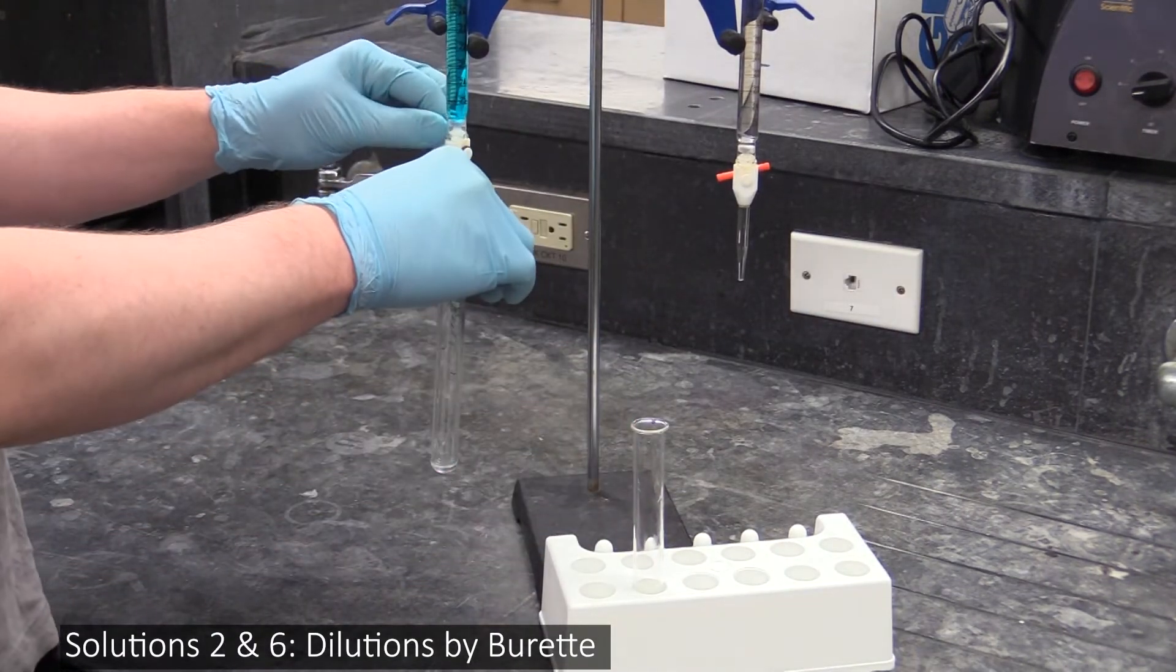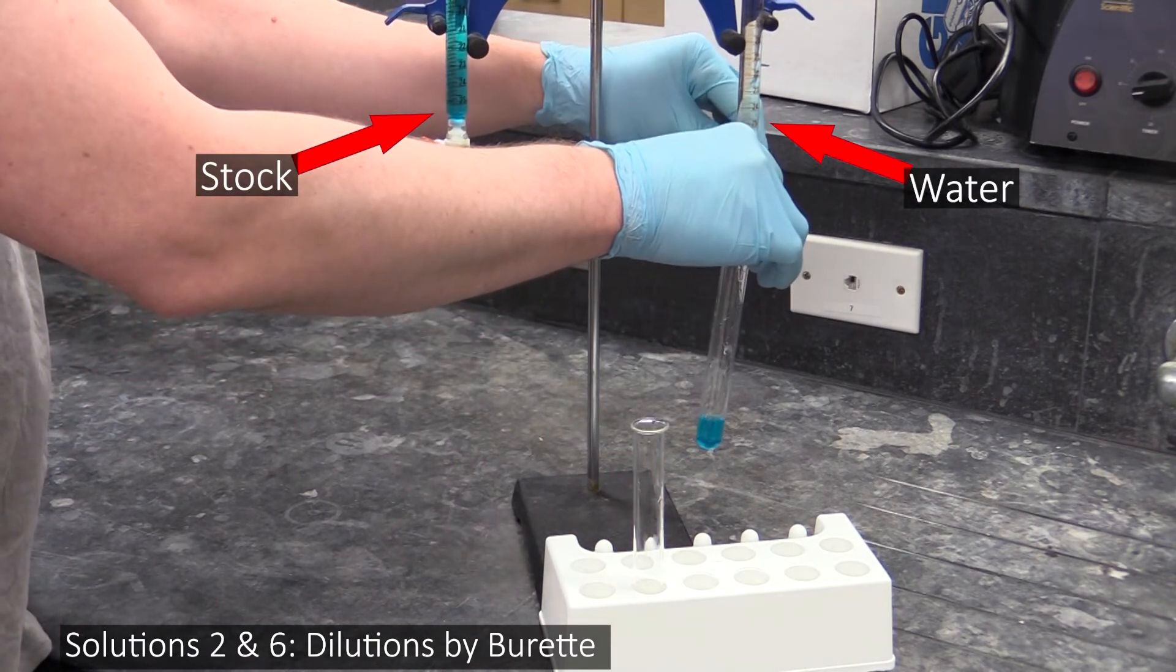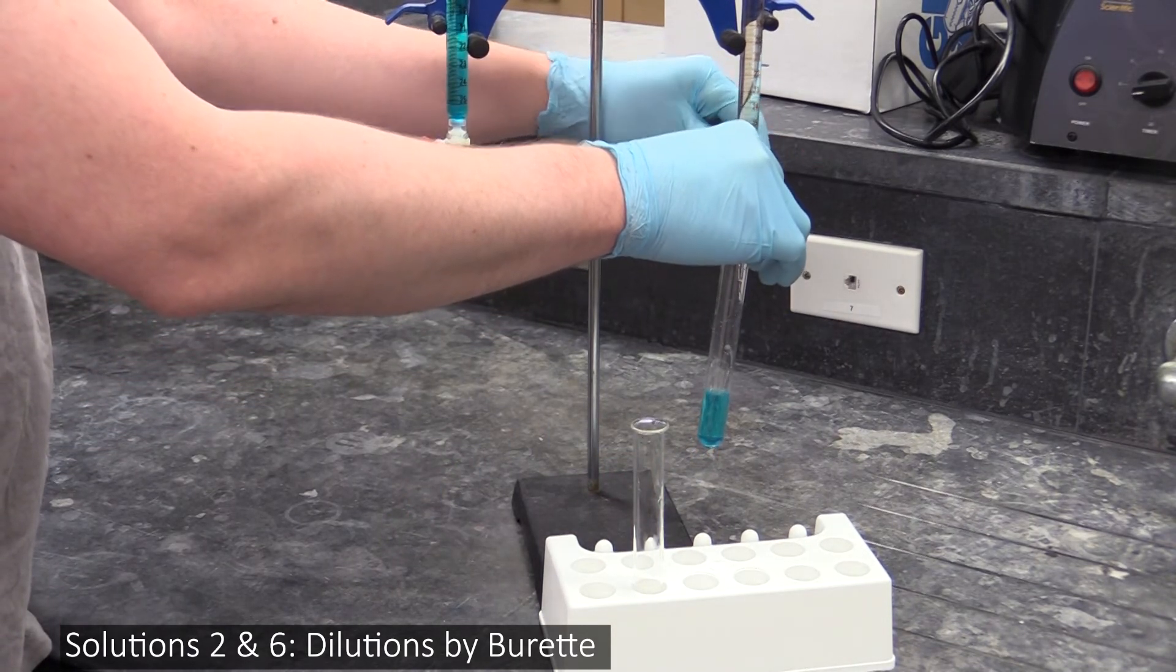To make your last two solutions, you'll mix different amounts of stock and water together in test tubes. Again, you'll use burettes to dispense these.